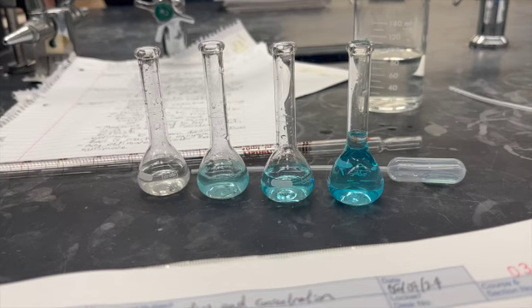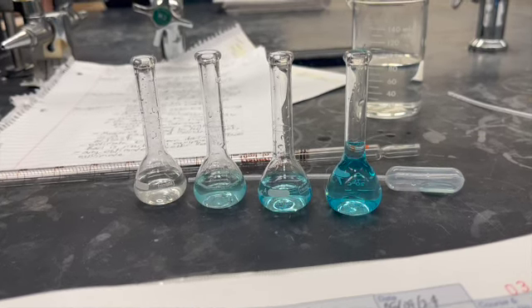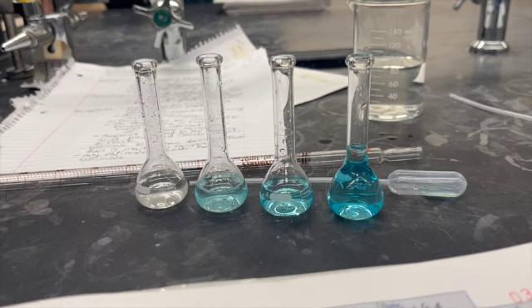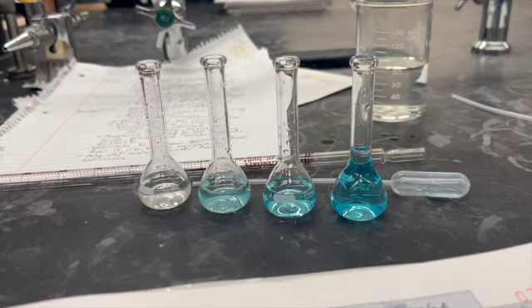We want to get to the experiment, but first we've got to define a couple of things. First we're going to compare a stock solution and a dilution, then we're going to define a meniscus. The stock solution, which in this clip is on the far right, the darkest blue one, is essentially your base solution, and it's the one that you create your first dilution from.